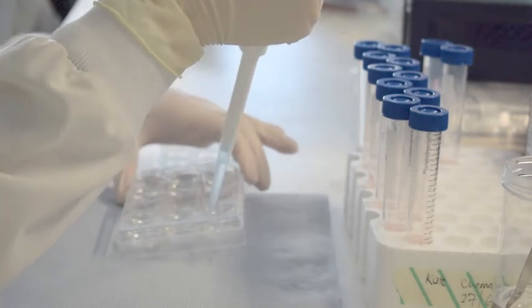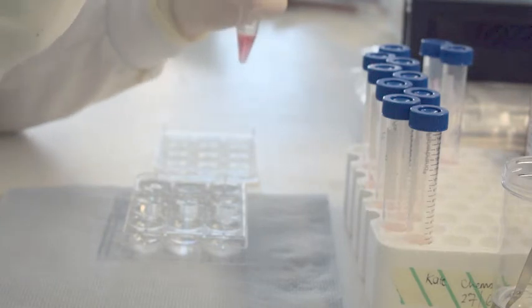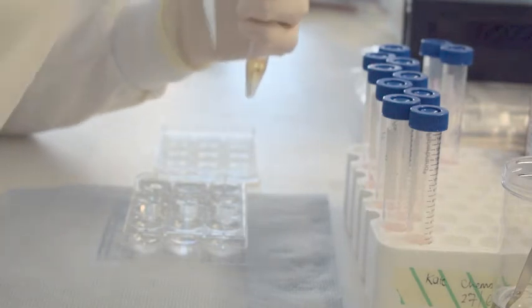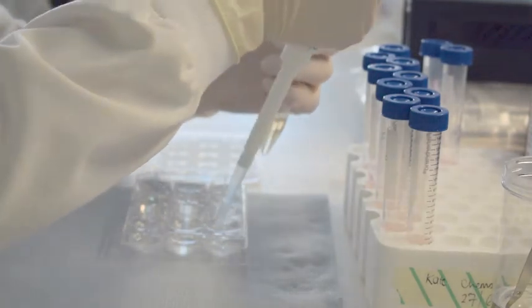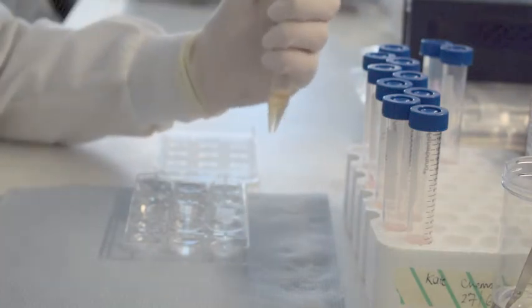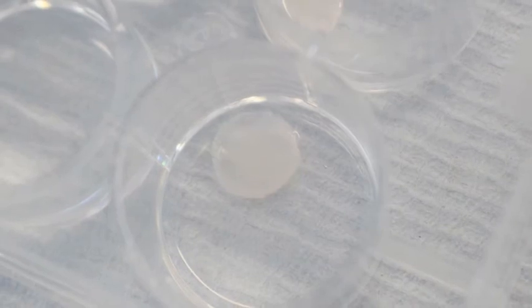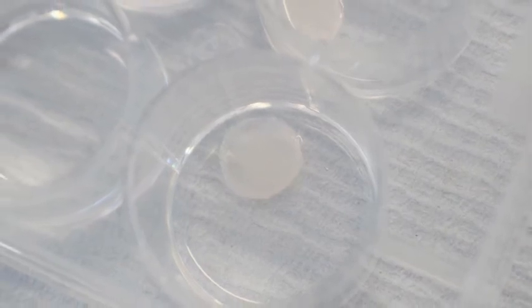The cell suspension is then transferred to a centrifuge tube containing 1 millilitre of trypsin neutralizing solution or DMEM containing FBS. The stratum corneum should be the only thing that remains in the final well.